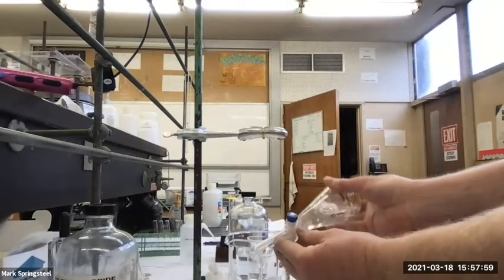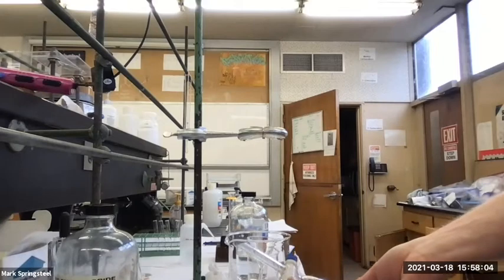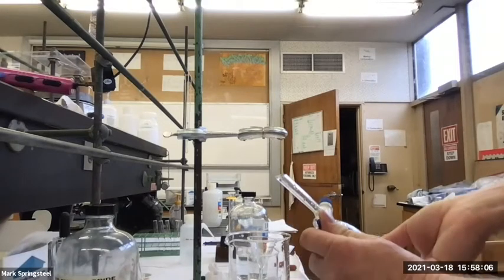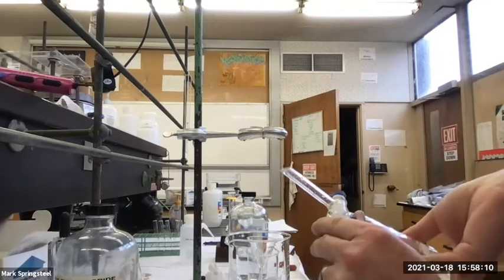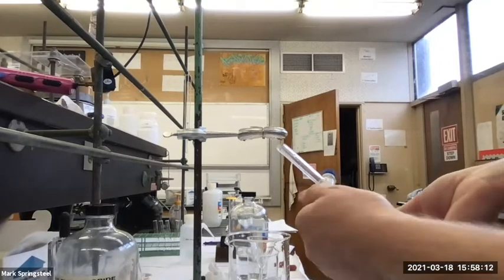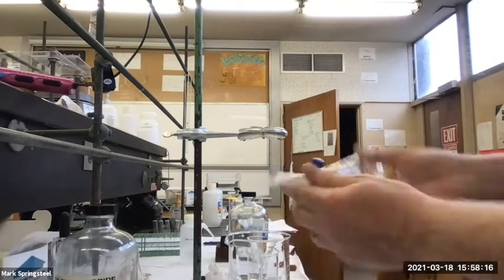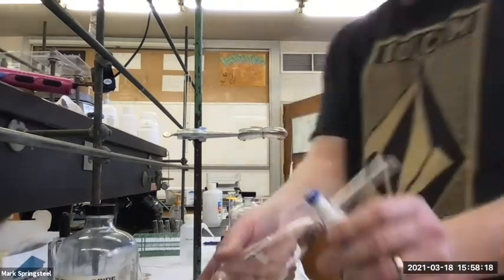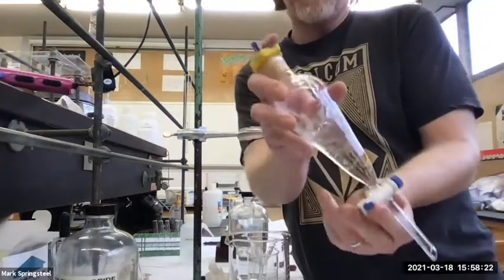Okay, now I'm going to go back. Go just real gentle. Forward again and then vent. Did you hear it? Oh, sorry, I wasn't showing. It's venting pretty good actually. Getting less. I think if I do it this way, it'll look better for you. Yeah, see, I'm pointing it away from me. It's still venting.